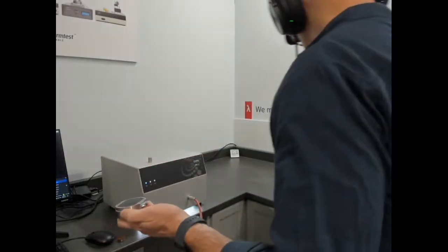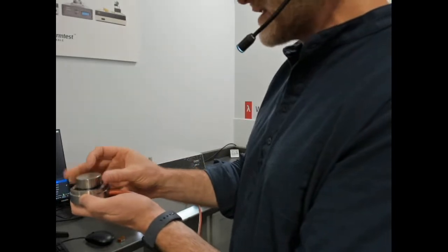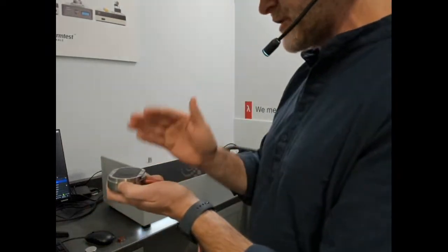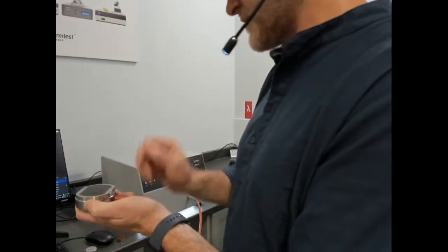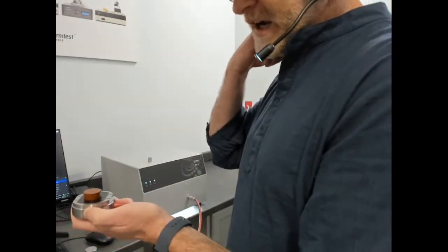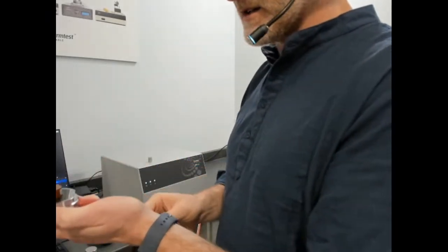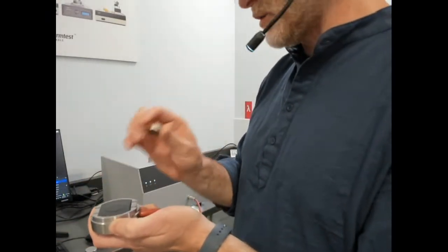Bulk properties, so that would be a measurement on a more typical sample where you're covering the sensor times 2 at least, as well as anisotropic, so measuring 2 directions. That's described in the ISO-2, but we can do that asymmetric. And then now with this new -7 standard, short time scale effusivity for looking at one-dimensional effusivity on lower effusivity materials.